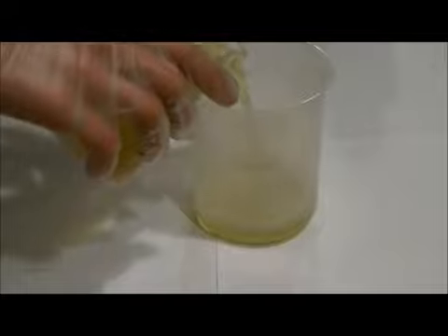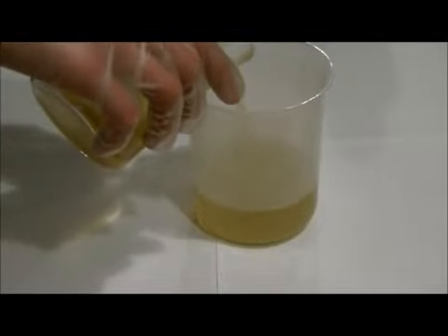I've let it cool. Now we're going to decant all the water and sulfuric acid off into another beaker. We'll decant it a few times to get as much sulfuric acid out as possible, as this will be a contaminant and we don't want that.